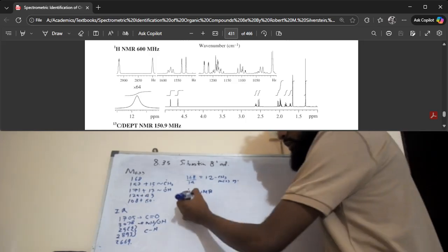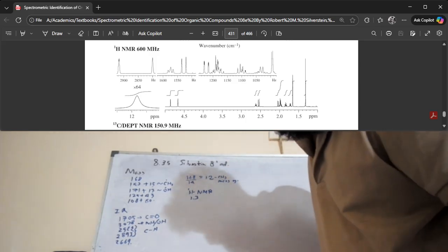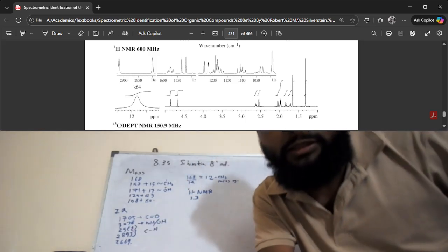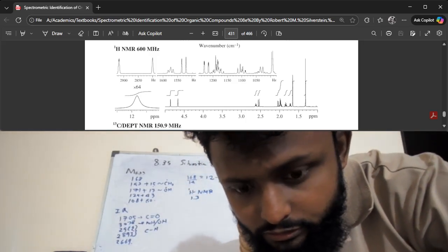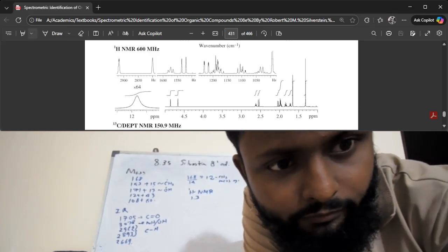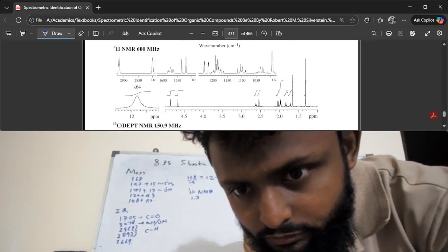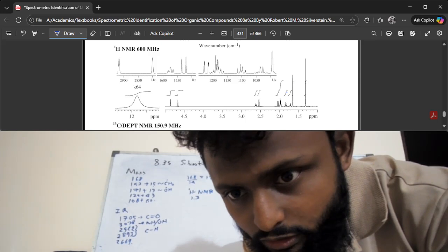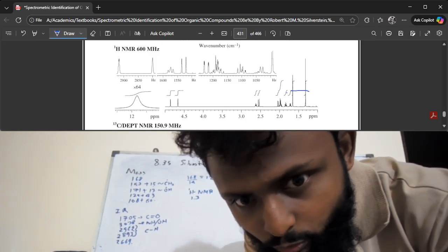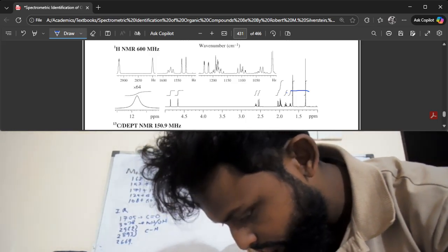You have the 1.3 peak, which, if you look at the height of the integral, is the tallest integral. At the same time, if you consider these peaks, these are one third the height of that. If you draw a line like this, you can see it's about one third or half. Is it half? No, it's not that.